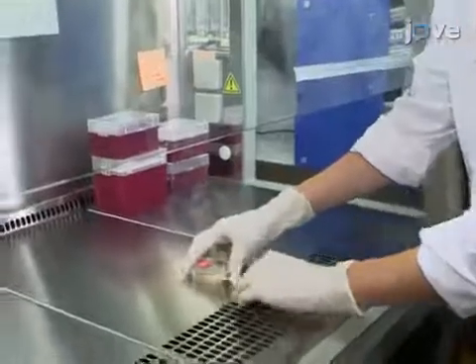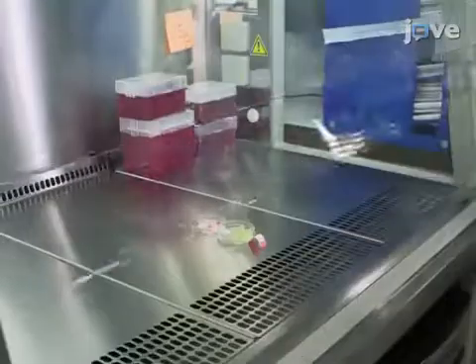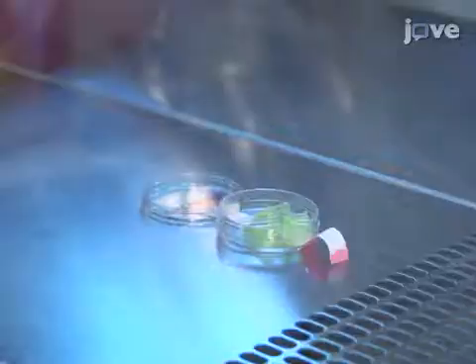Sterilize the catheters in a laminar flow hood for one UV cycle of approximately 25 to 30 minutes.